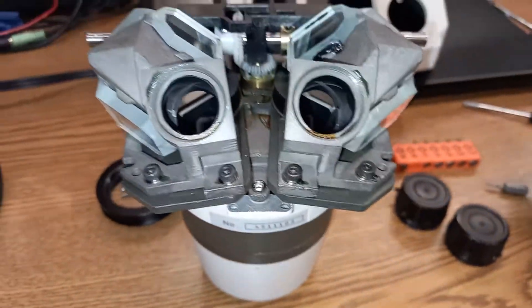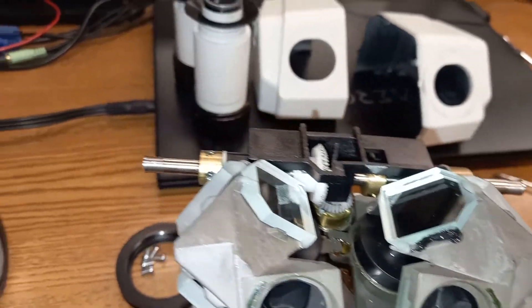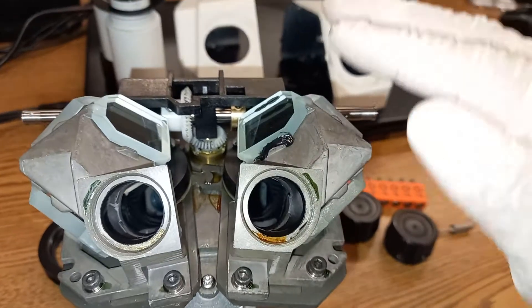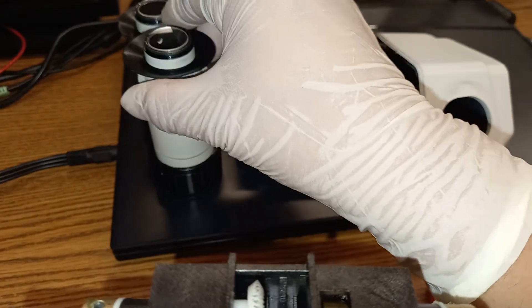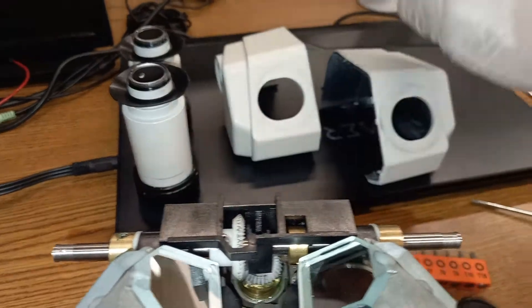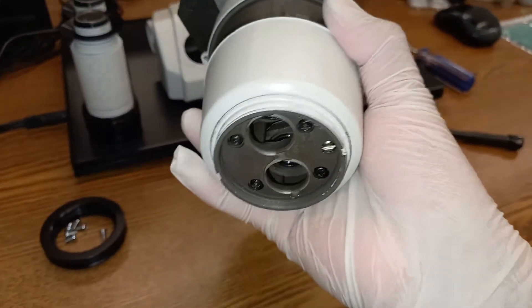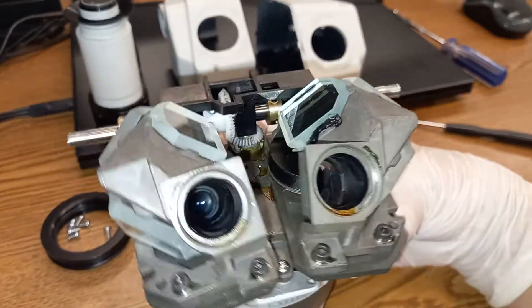So that's something I want to point out. And once you have that, everything will go smoothly. This thing is taken apart basically like a 3D puzzle — you need to remove this before you can remove the housing. But before you can remove the housing, you need to unscrew these; this just screws into place on both sides. You can see this in a 3D 360-degree view of the microscope components.